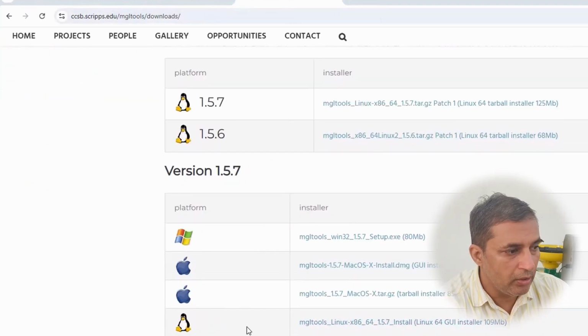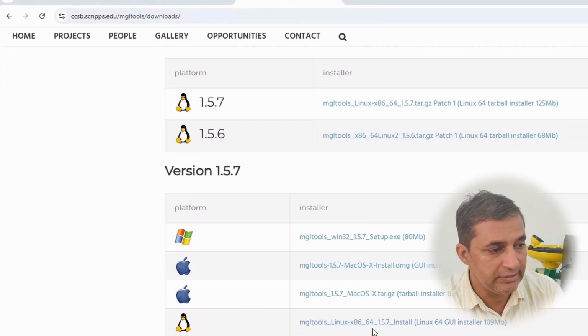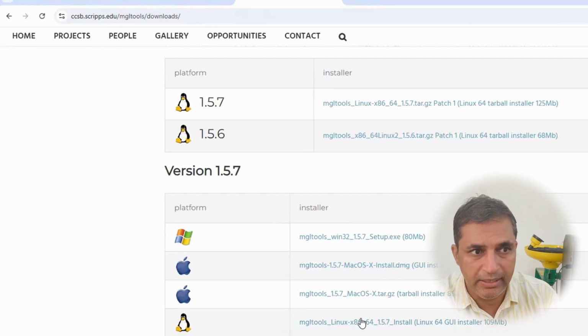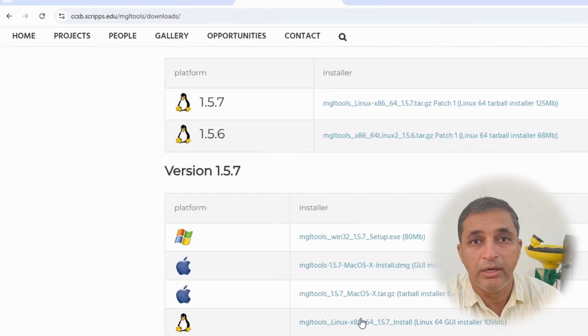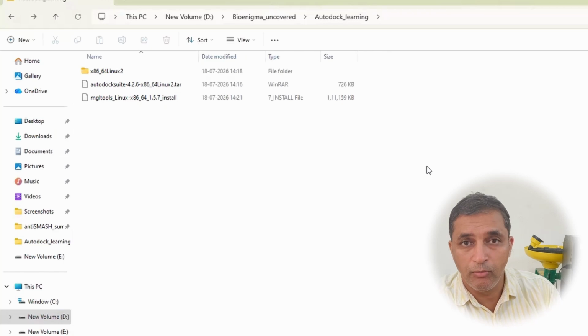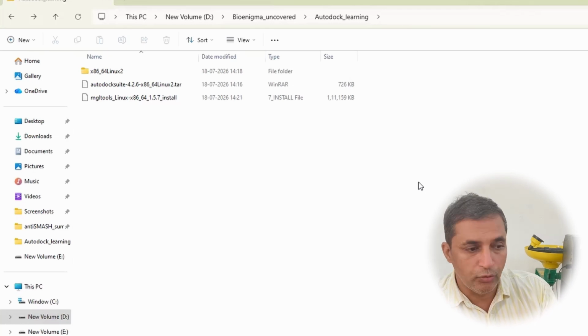Herein, scrolling down, you will see two options for the MGL tools. One is MGL tools GUI. Of course, this MGL tools is the graphic user interface. So I'm going to select this very first option and click on this link. This installer is around 100 MB, and within 1 to 2 minutes your MGL tool installer will be downloaded into your C drive within the download folders. I have now moved my MGL tools installer to my D drive within the AutoDock underscore learning folder. So again, I'm going to move to the terminal.